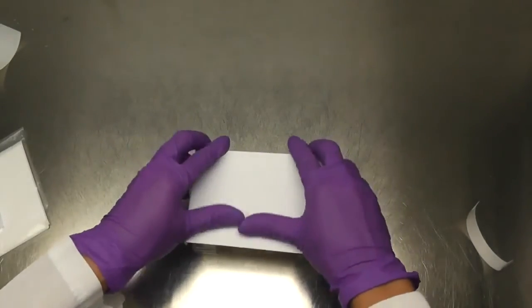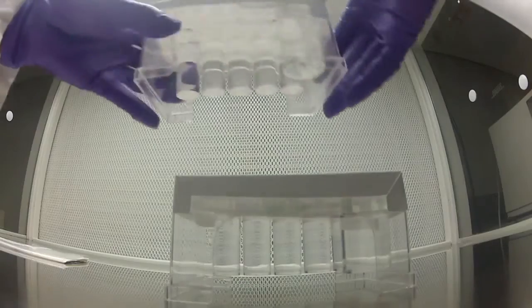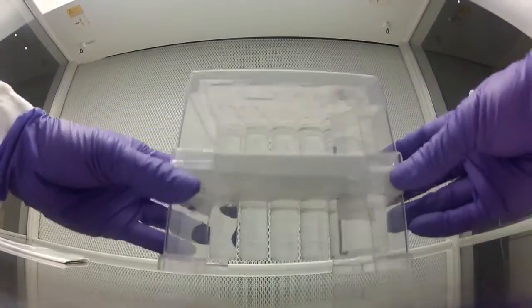Your sample is now ready for incubation. The IMPN plate is stackable for easy transfer around the lab and incubation.